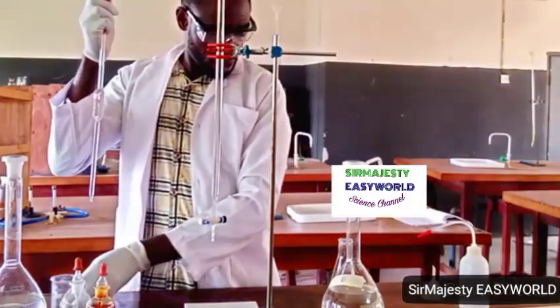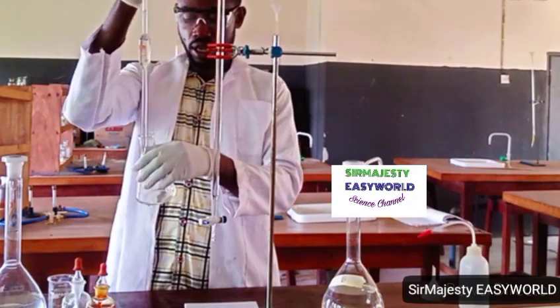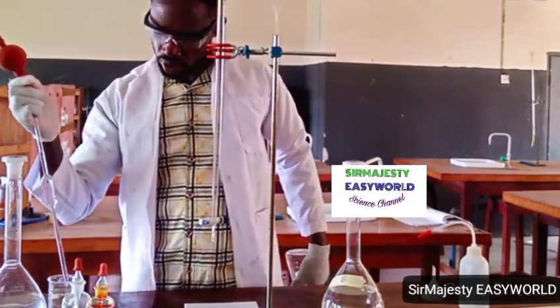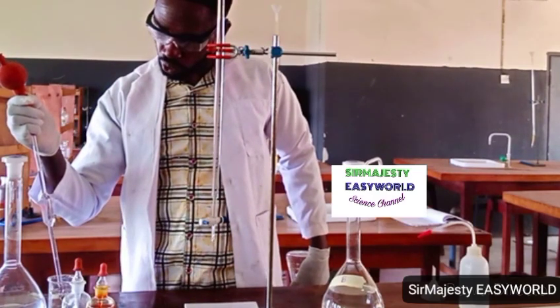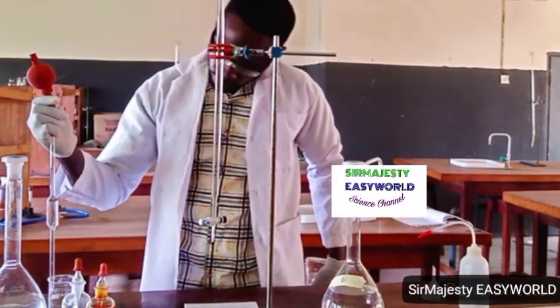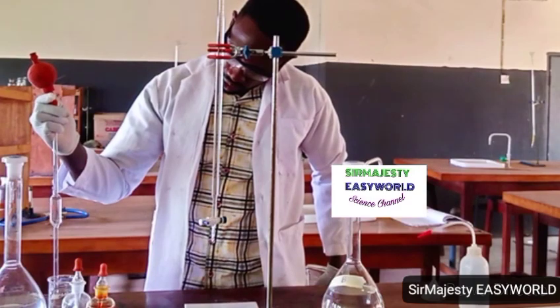The concentration of the acid I'm using is 0.1 mole or 0.11 mole. That's the concentration of the HCl. So you can now use the endpoint to calculate the concentration of this base.